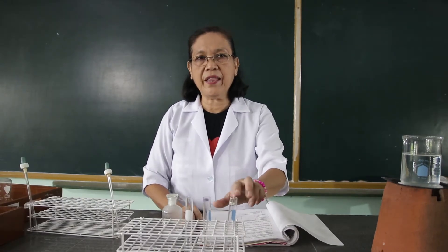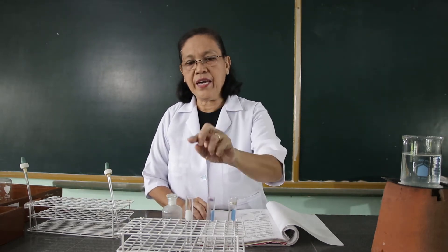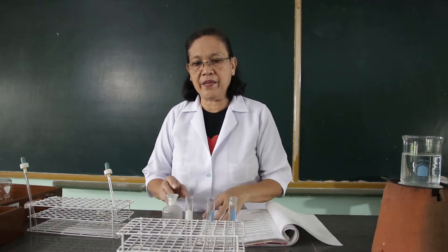For the first part of this activity, we're going to test the reaction for the aldehyde, ketones, and the aromatic aldehyde with the 2,4-dinitrophenylhydrazine. We have here three test tubes. We are going to fill the first with the aldehyde, which is the formaldehyde. To the second tube, we are going to fill this with the acetone. And to the third test tube, we are going to fill this with the benzaldehyde.